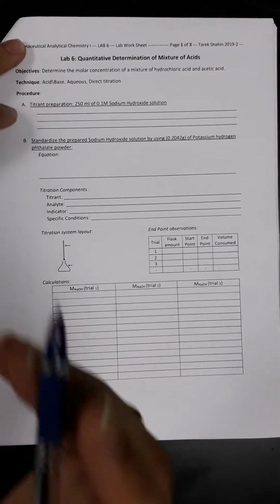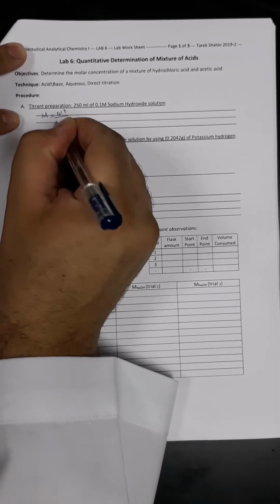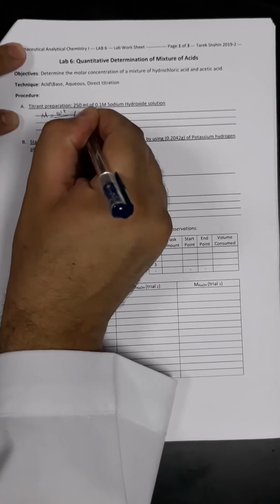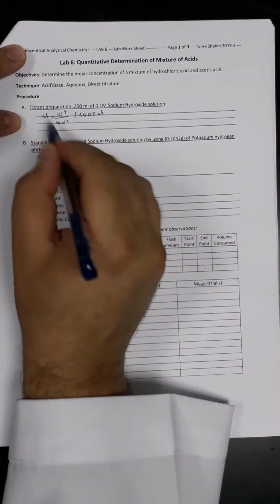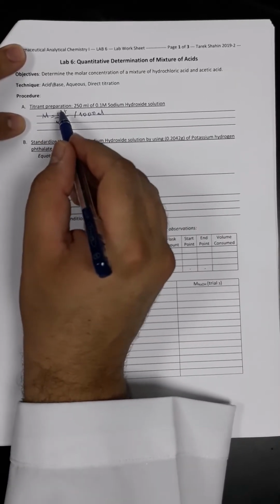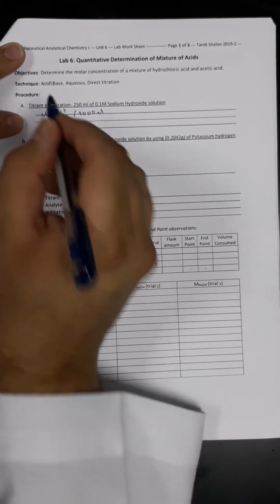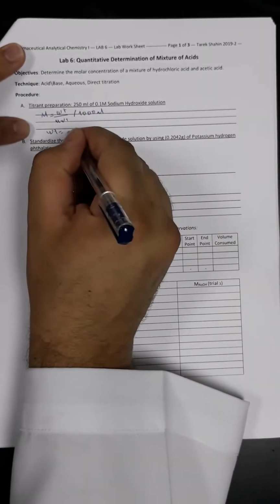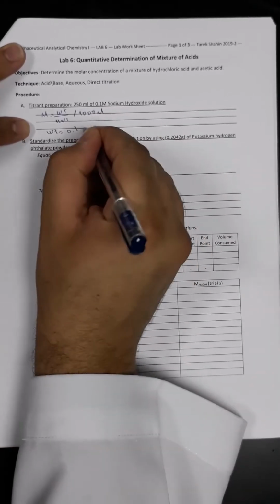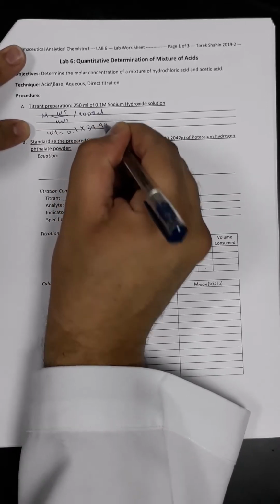Okay, for the sodium hydroxide pellets, we have to use the following equation. So the molarity will be equal to weight subdivided by molecular weight per each 1000 ml of solution. Okay, so what is the unknown in that equation? The unknown is the weight. We want to know exactly what is the amount of sodium hydroxide we are going to take to prepare that solution. So we will say that the weight will be equal to molarity, which is 0.1, which is the one I want to prepare, multiplied by the molecular weight of the sodium hydroxide, which is 39.99 gram per mole.